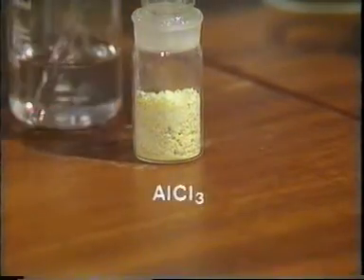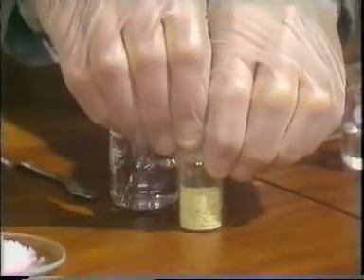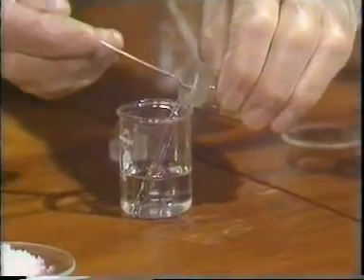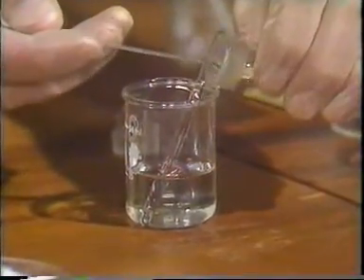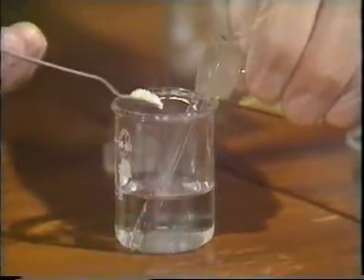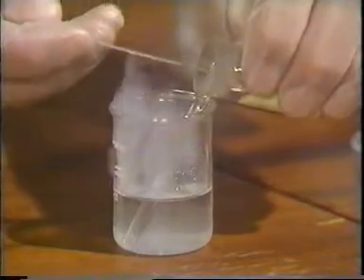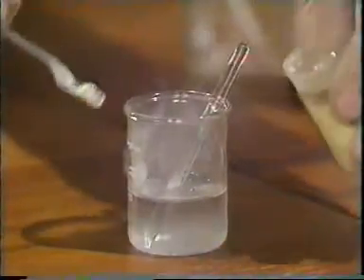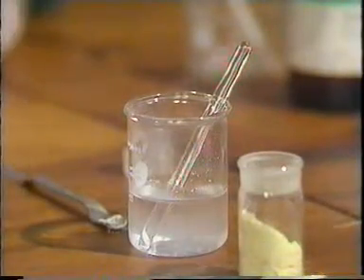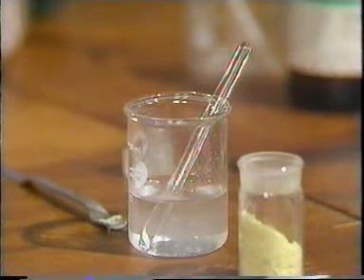Next we have aluminium chloride, and we know that this reacts with water, and that's why it's stored in a weighing bottle. If I add a little of this, it's yellow, by the way, because of a trace of iron in the aluminium. 100% pure, it's white. Now you can see when I add this, there's a very vigorous reaction with the water, giving off some fumes. And we can in fact see that the solid, even the solid in the weighing bottle, is reacting with the moist air.